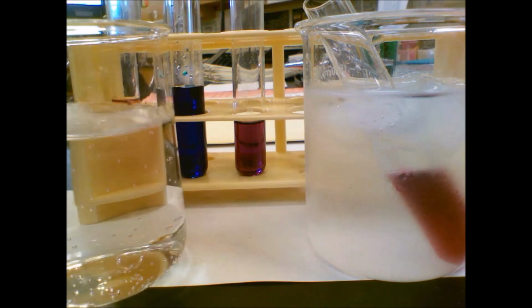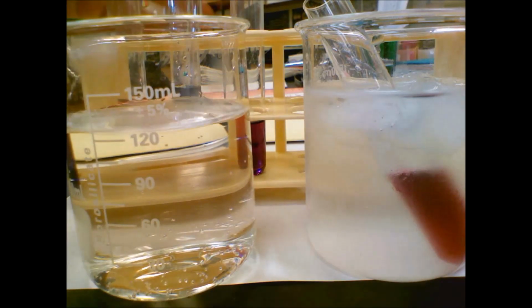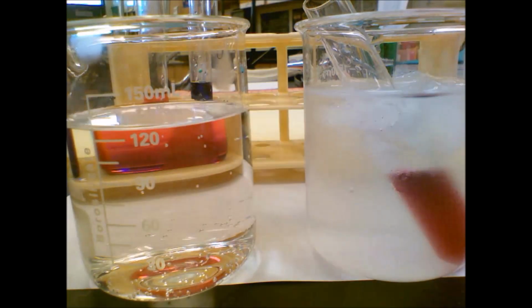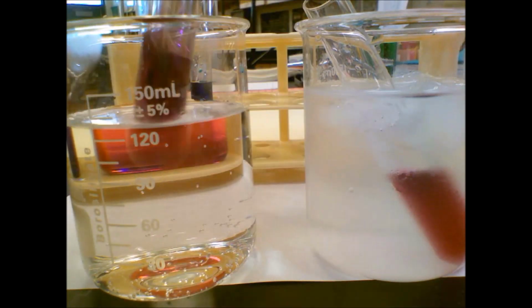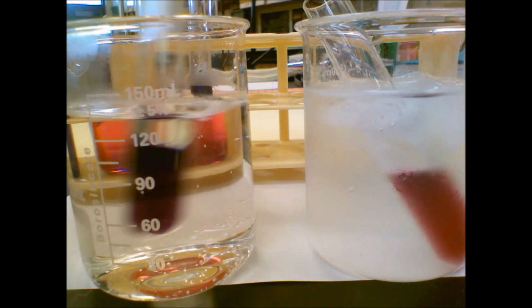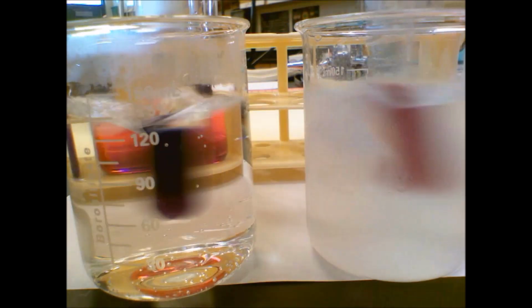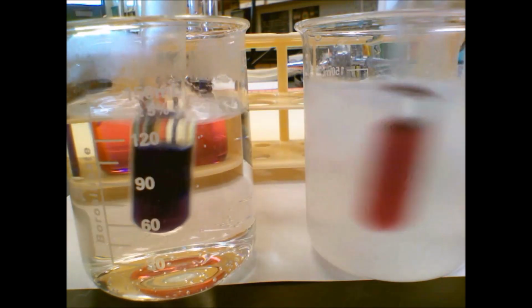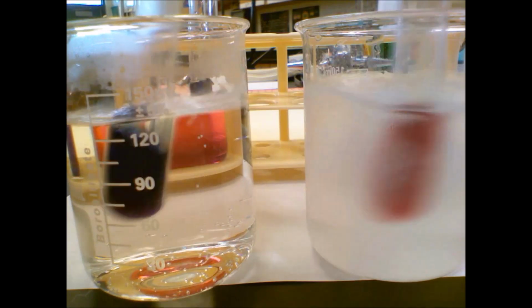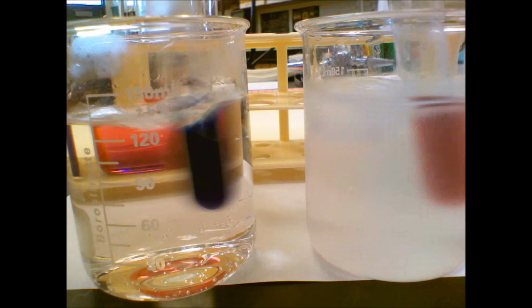All right. Sorry, it took me a second. We'll grab our hot water bath. Okay, and we're going to put our second one. So again, here's our purple to start out with, down into the hot water bath. And I'm just going to swirl these around. It says to do both for 5 minutes, but we'll probably see a change sooner than that. You might already notice a change.